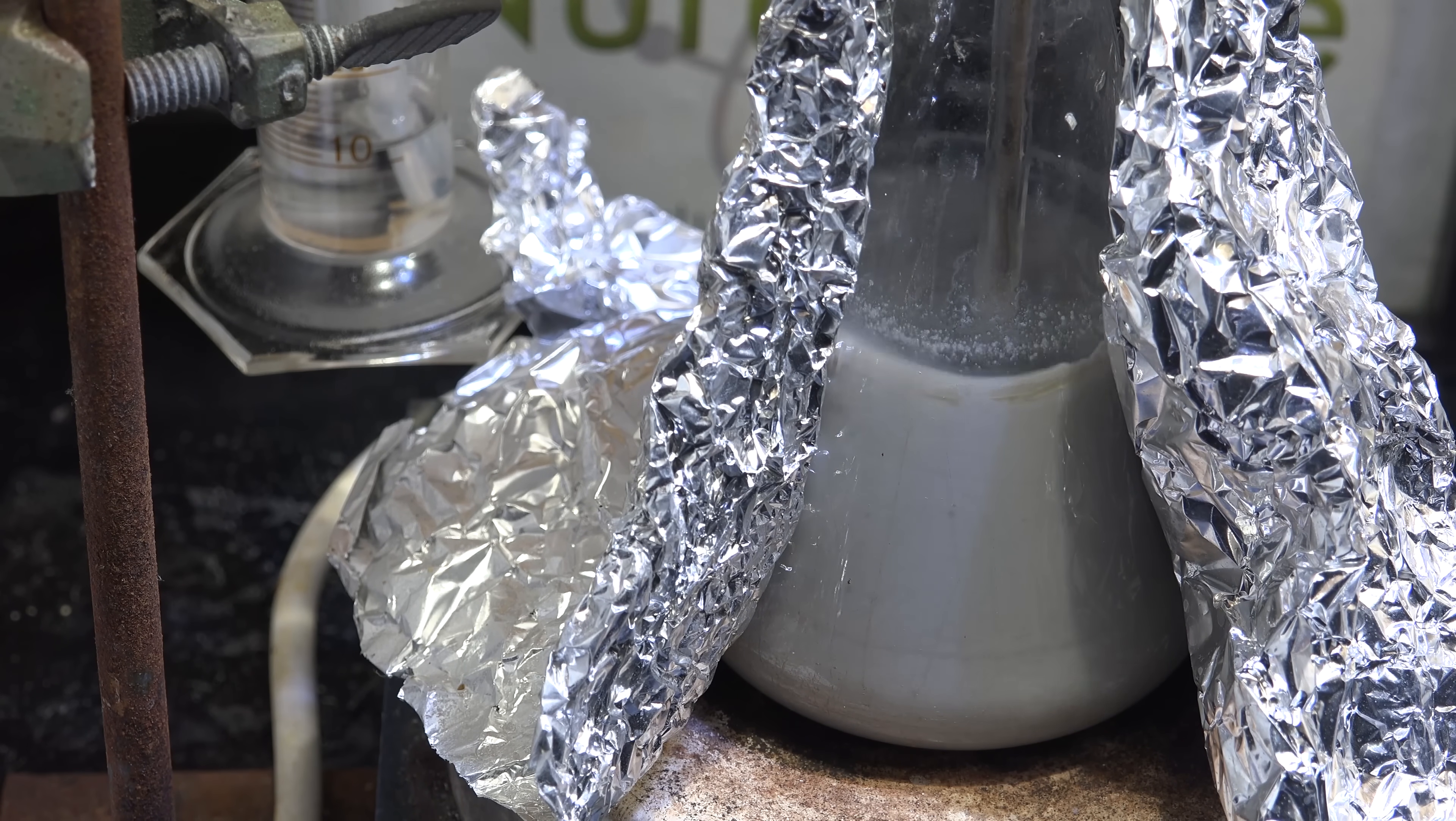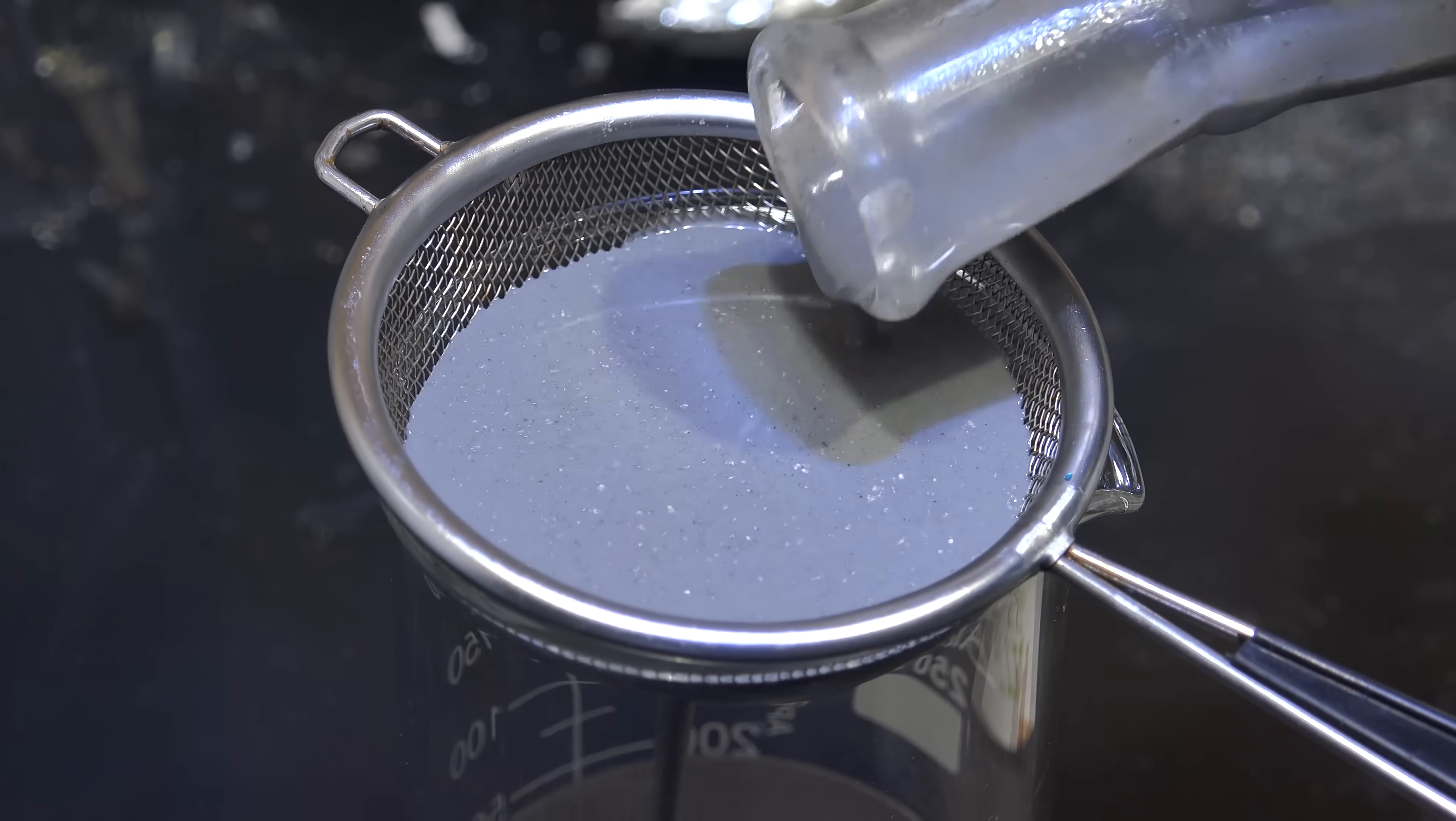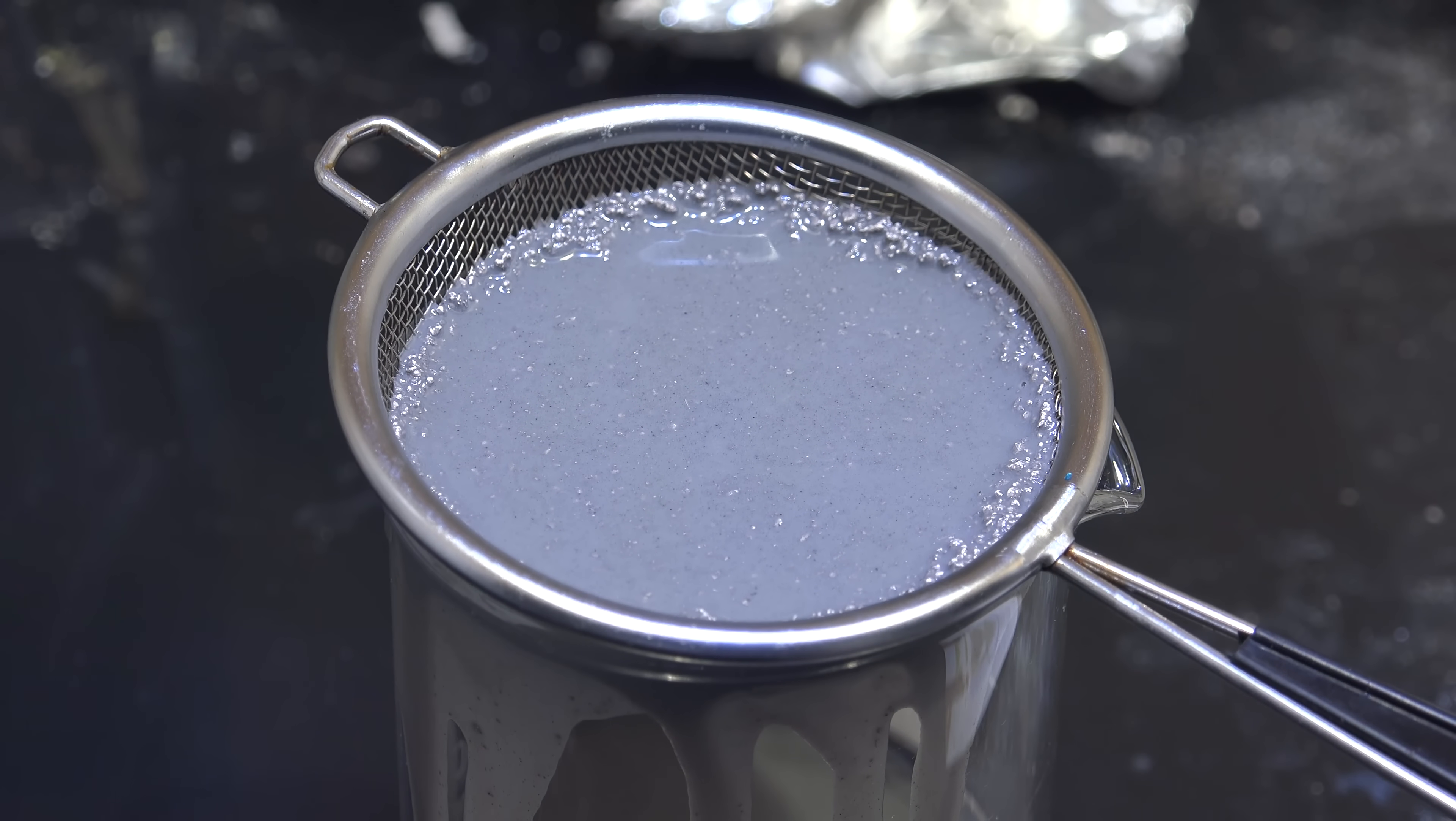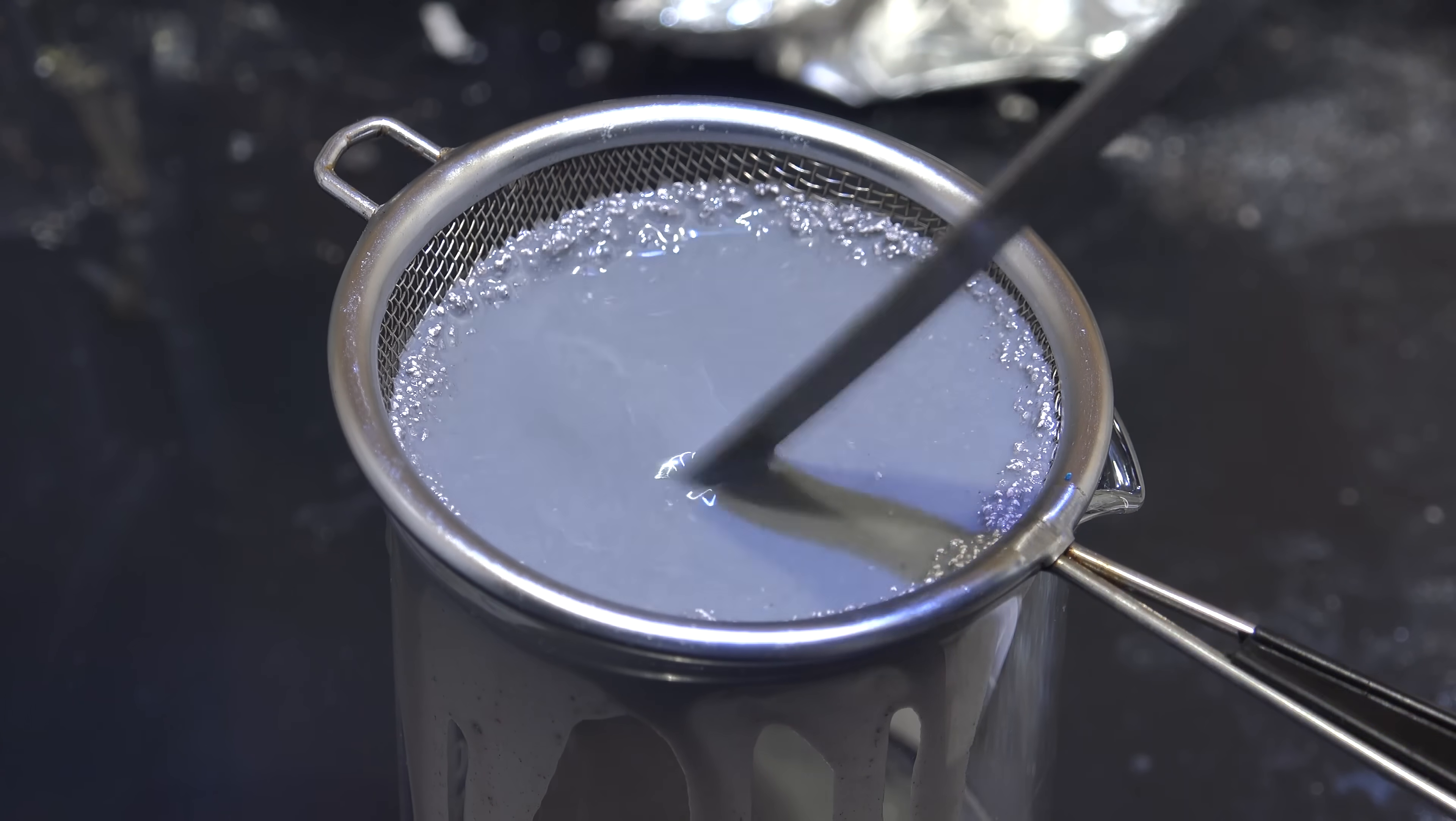Now that I've optimized everything else, we can go back to the alcohol and test out this tea tree oil knowing that if it doesn't work, the problem is truly in the catalyst mixture and it's not the result of some other interaction or problem with our reaction conditions. So I let this run and it seemed to stop working after a day. The bubbling wasn't particularly vigorous, so I don't think it worked super fast. The alcohol probably decomposed before it could finish.